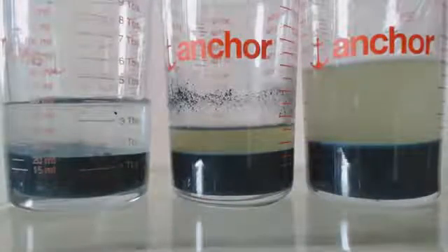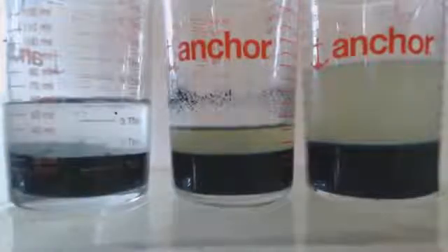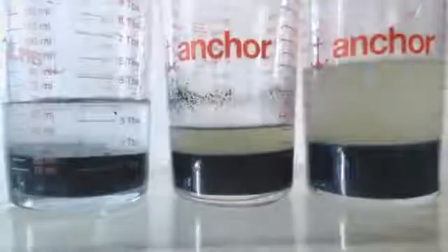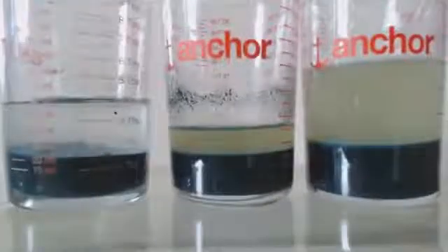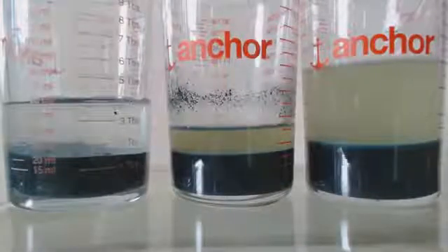These have been sitting for like a day now. The one on the left hasn't been sitting that long because I know it'll just clear up more and more, because all it is is chromium hydroxide, no sodium hydroxide, so nothing soluble.